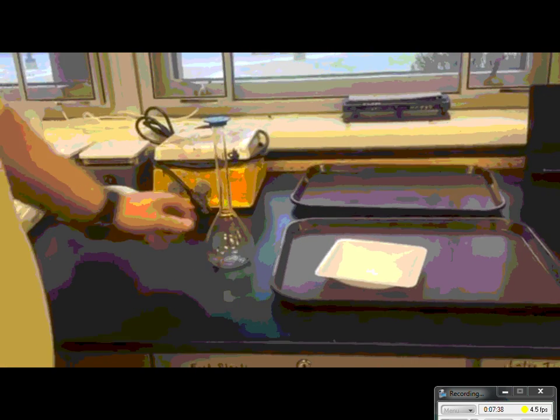There we go. I hit it pretty good. So now I have my mass of the salt.